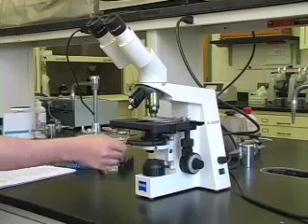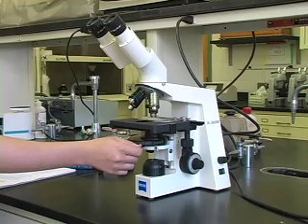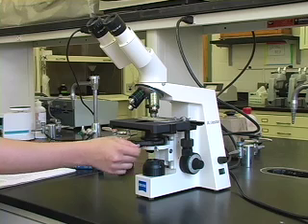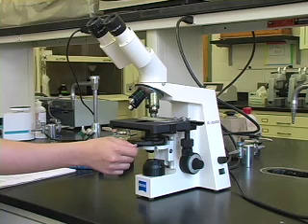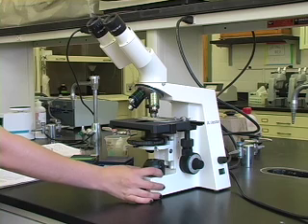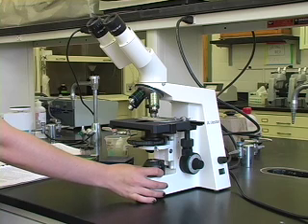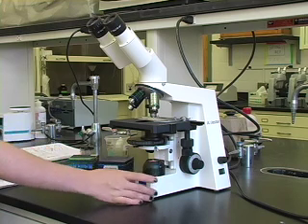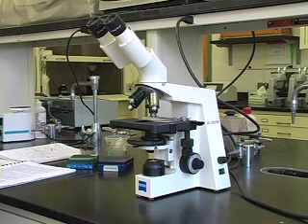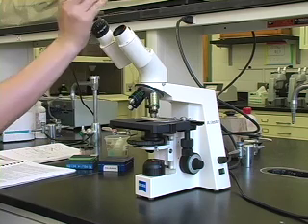Close the lamp iris all the way, then focus the condenser until the edges of the lamp iris are sharpest. Open the lamp iris until the bright polygon fills three quarters of the field. Center the polygon in the field using the centering screws. Open the lamp iris until the bright circle almost fills the field of view.